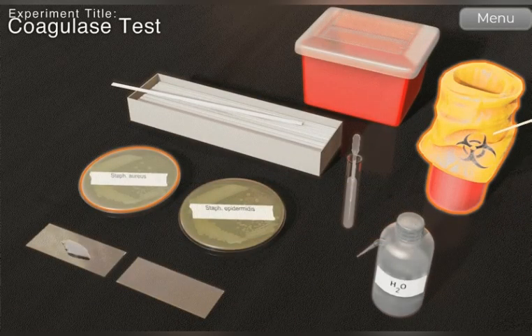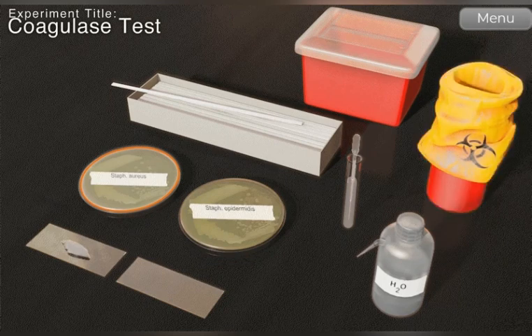Dispose the stick on the waste container and then add 1 or 2 drops of rabbit plasma on the slide.